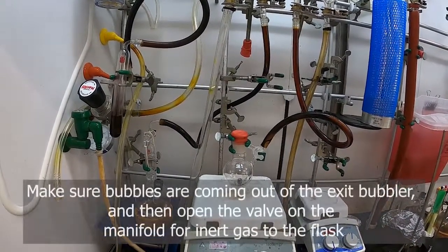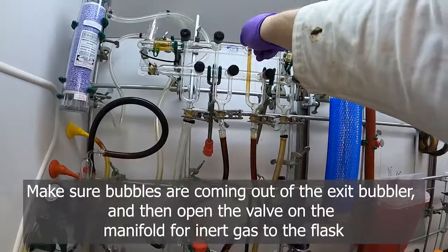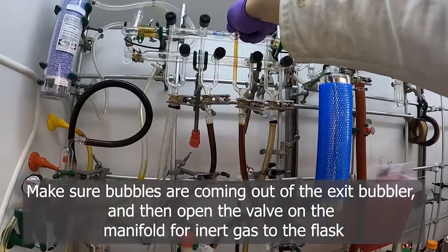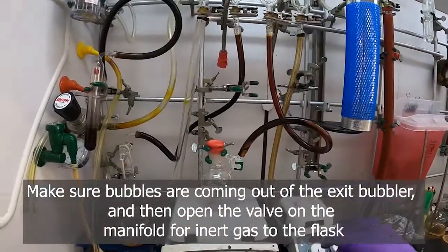And we can open up the nitrogen side, the valve above it. And we'll fill this with nitrogen.